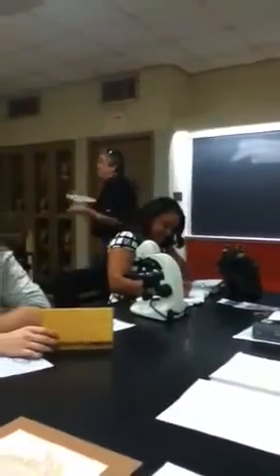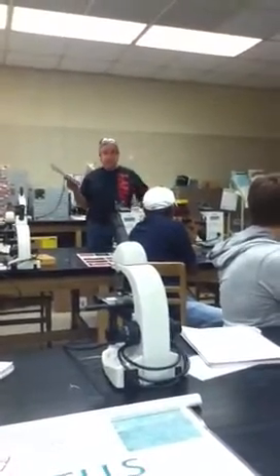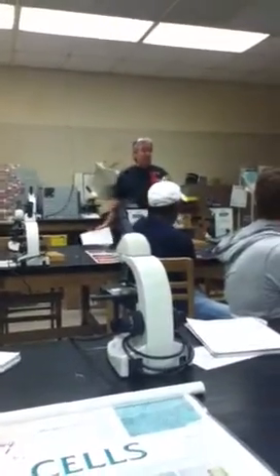Alright, so you got the bacteria over here on the table. We got slides out where you can look at some of the basics. We got some posters to look at to let you see the difference in the different items. And a nice big poster of a bacterial cell to kind of give you an idea of the layout.